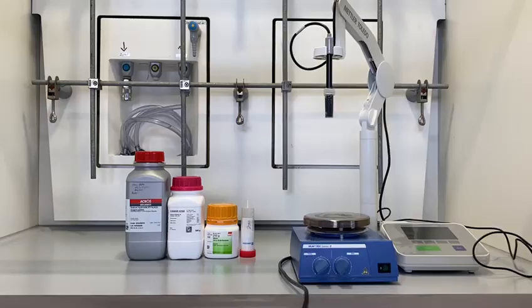In the next part of the preparation, we are going to prepare buffers for maintaining the pH level in order to separate lysozyme from the rest of the proteins.